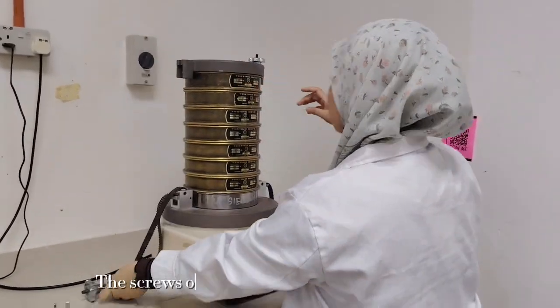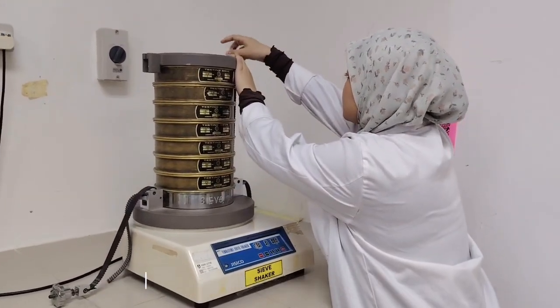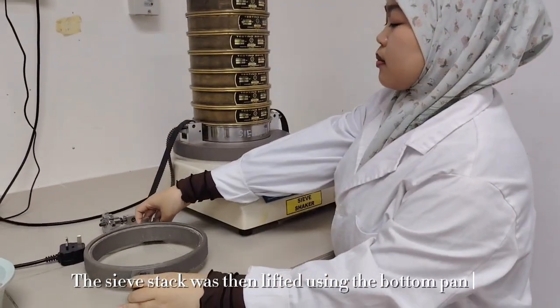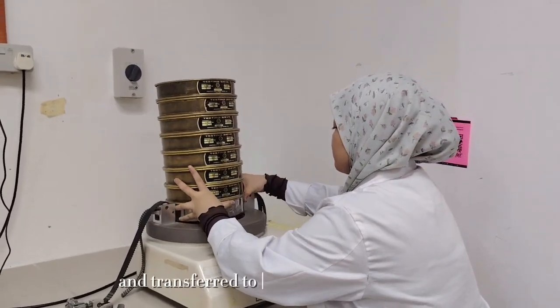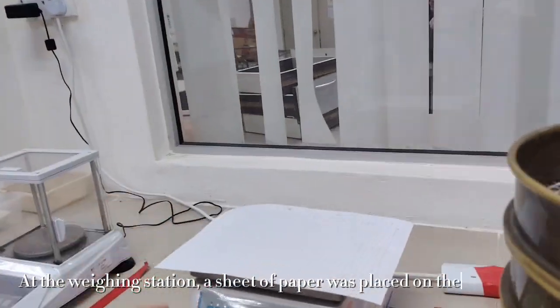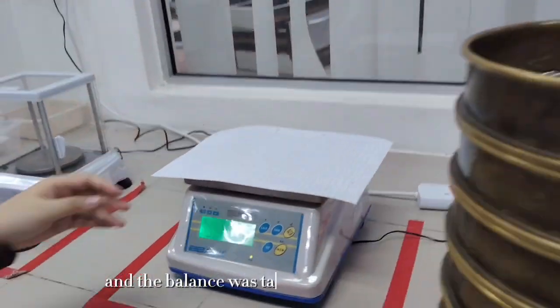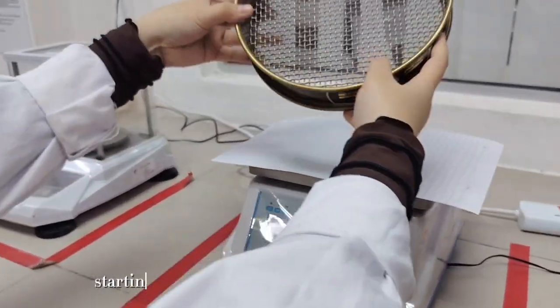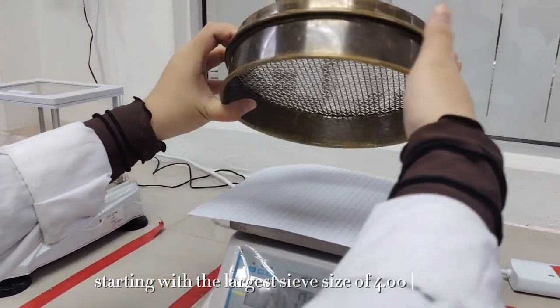The screw on the vertical rod was loosened and the lid was carefully removed. The sieve stack was then lifted using the bottom pan and transferred to the weighing station. At the weighing station, a sheet of paper was placed on the balance and the balance was tared before weighing. The sieves were then checked one by one, starting with the largest sieve size of 4 mm.